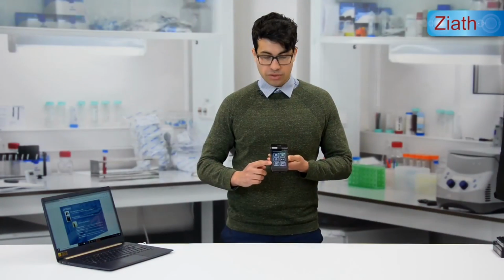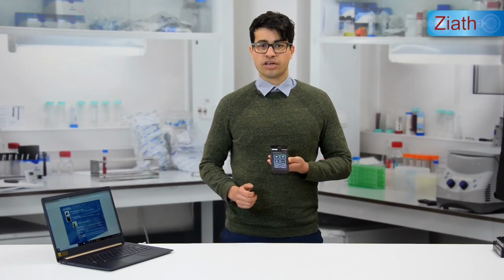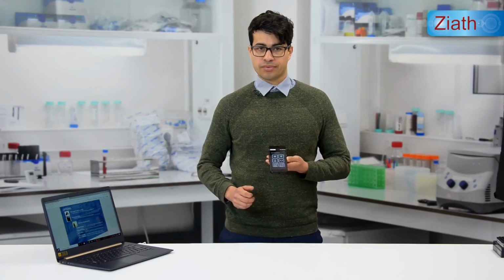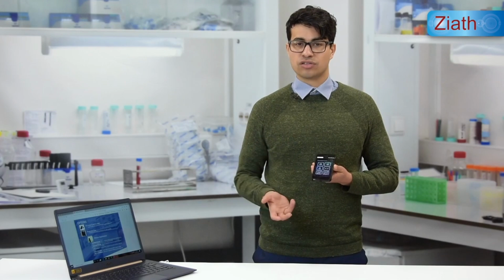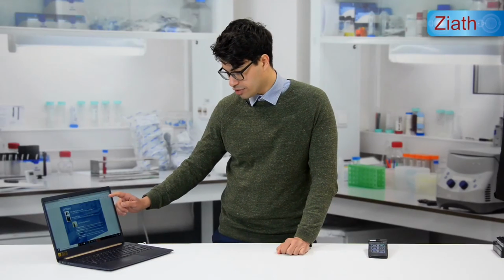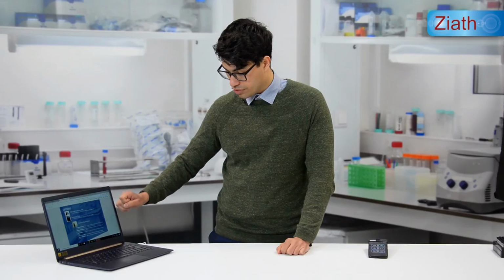The application in the bottom left is the handheld server. The handheld server is an optional extra which must be purchased separately. Once the handheld server is purchased, you can then buy additional extras for the device. These optional extras, which are all purchased separately, are shown on screen here.